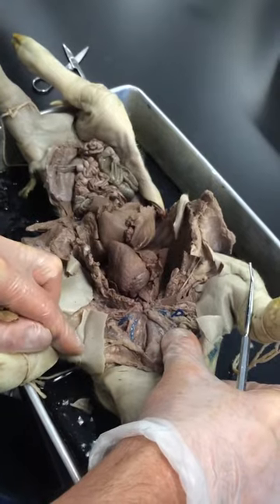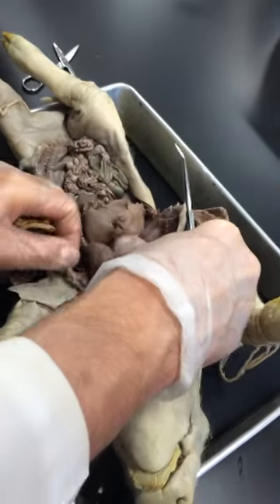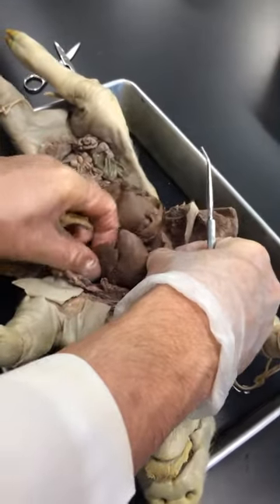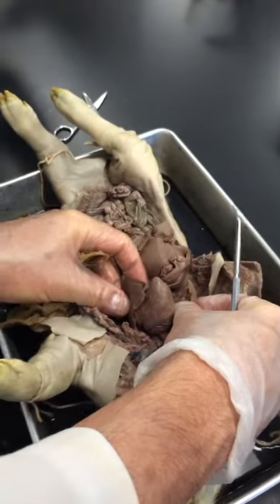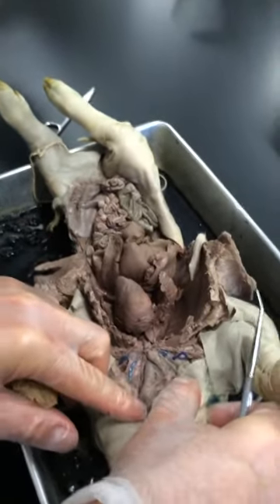Right and left lung — here are your lungs on either side of the heart. Student: Where's the larynx again? Instructor: The larynx is the big swollen part right here.